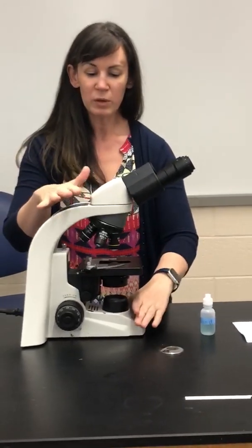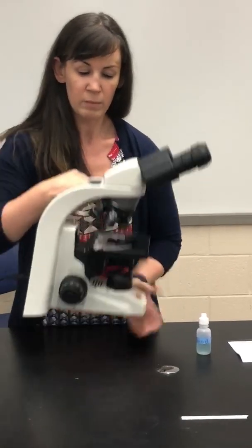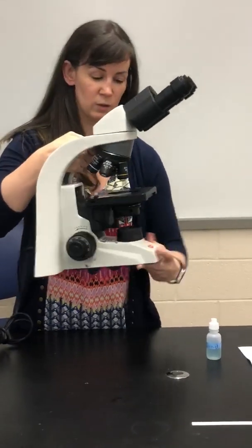So whenever we are using our microscopes, we always want to take very, very good care of them. The microscopes are located on the sides of your lab benches in the tall cabinet, and whenever you bring the microscope out or put it back, you want to make sure that you hold it by the arm and under the base, okay? Always use two hands, don't just use one hand to hold your microscope.